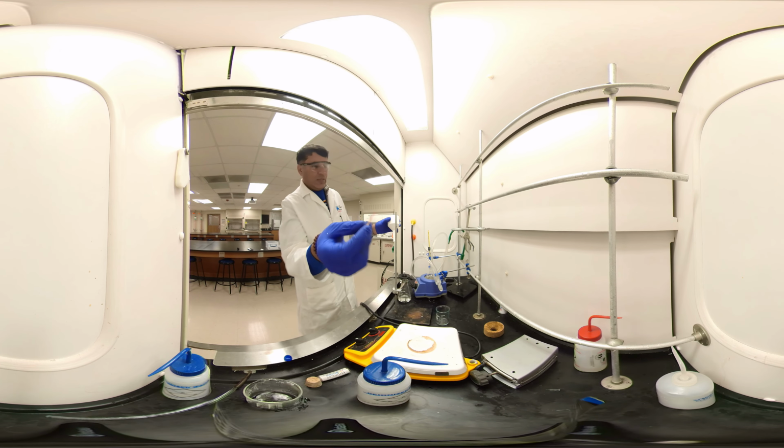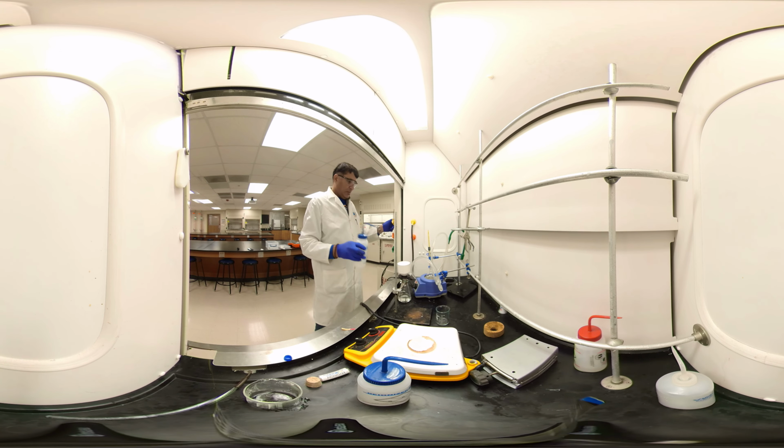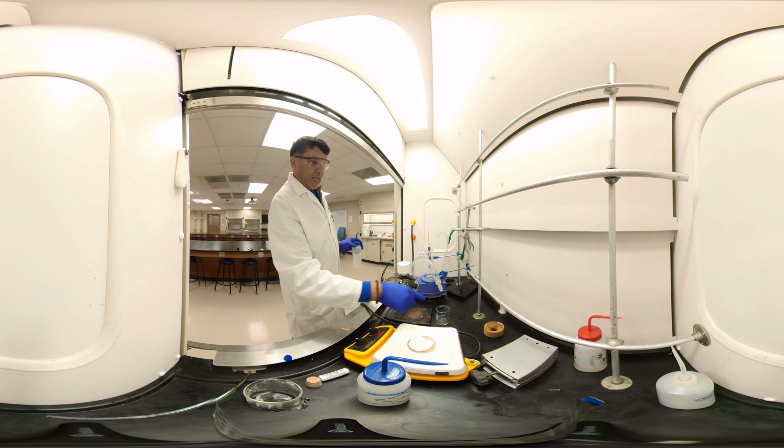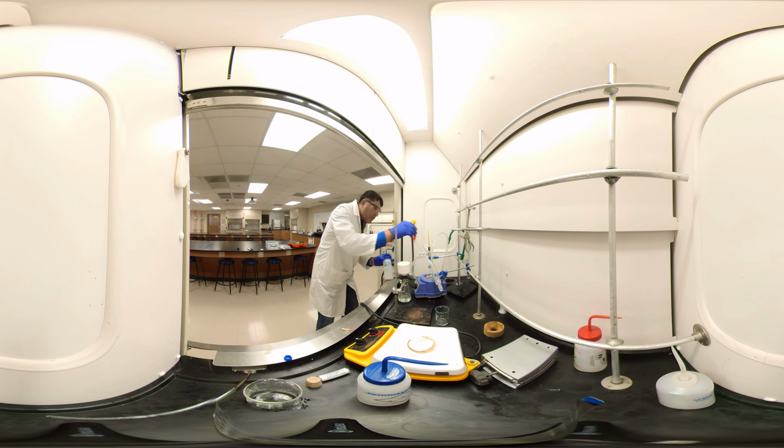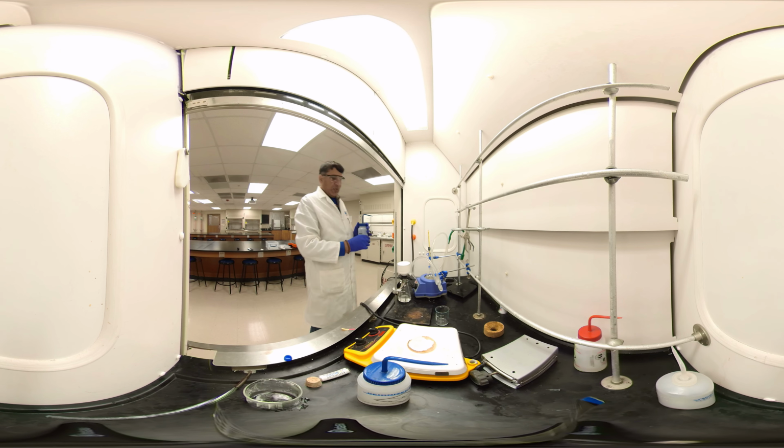No, it's still acidic. We need to wash more. So now you can see on the side, the dichloromethane started coming out. See the drops here? So we'll keep heating and the temperature is about 40 degrees. Keep heating until most of the dichloromethane is coming out, and keep washing the benzoic acid.